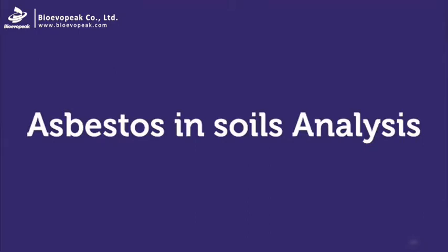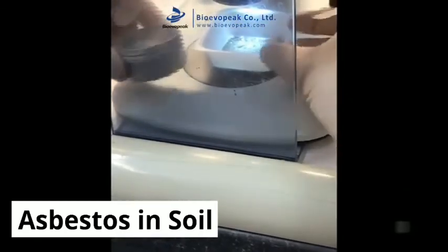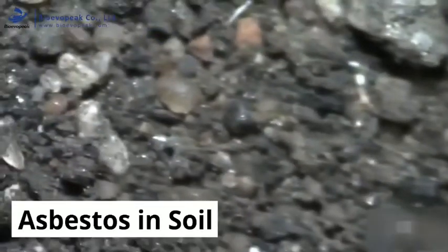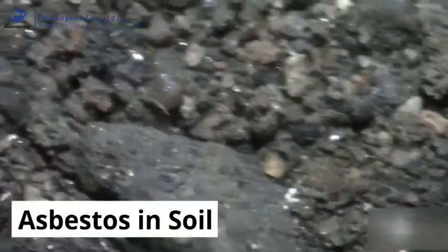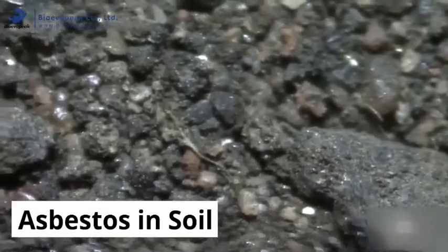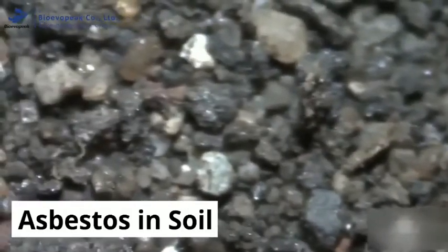At AEC, we also analyse soils for asbestos and are working with BOHS to develop training courses for the analysis of soil samples. The process is an extension of standard bulk analysis and involves assessing soil samples under the stereo binocular microscope after the material has been dried and prepared. AEC offer all 3 recognised levels of analysis.